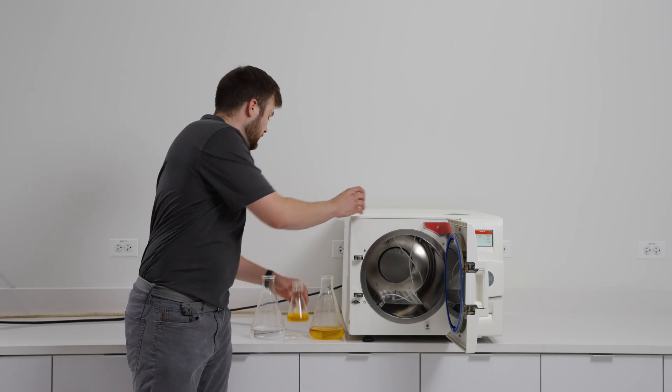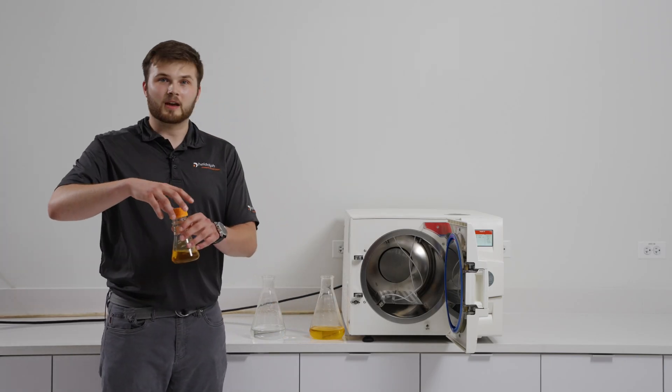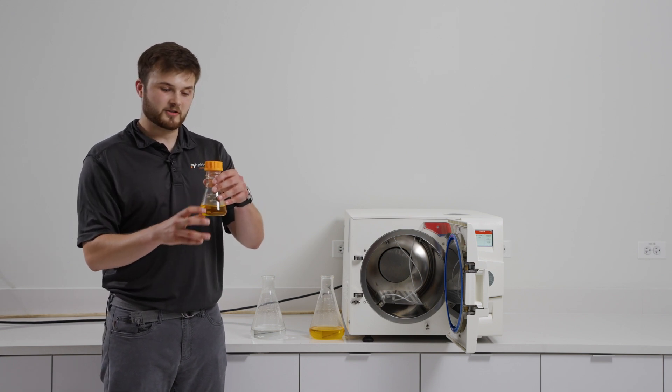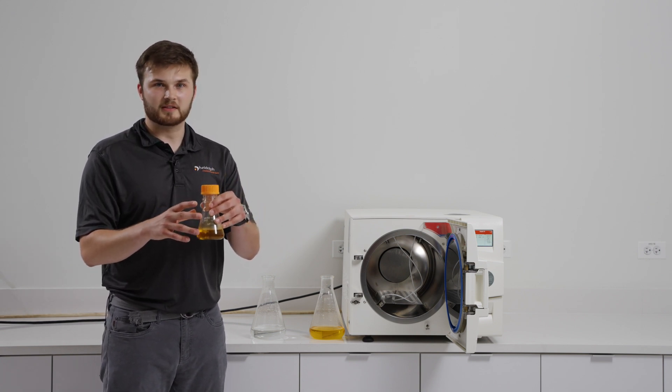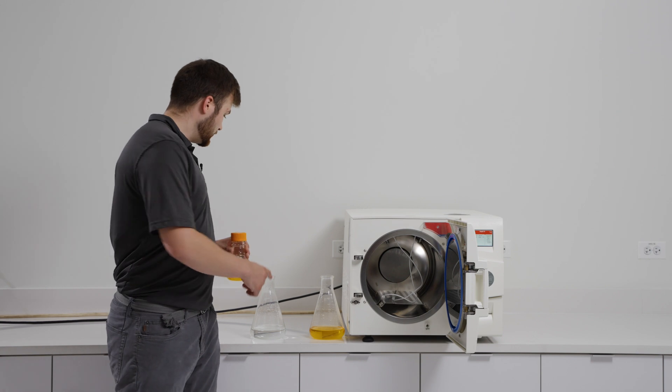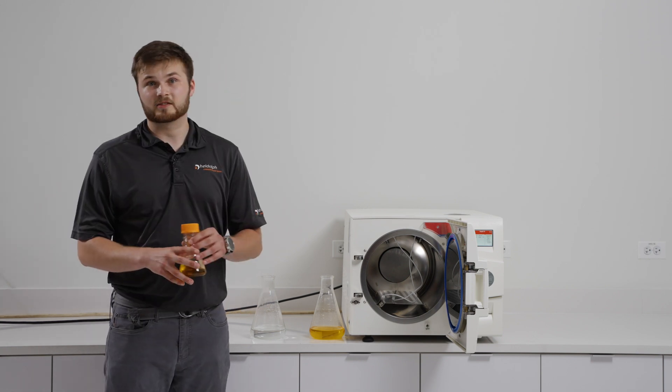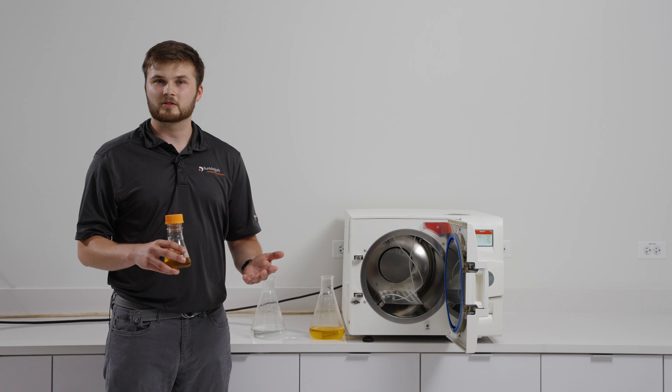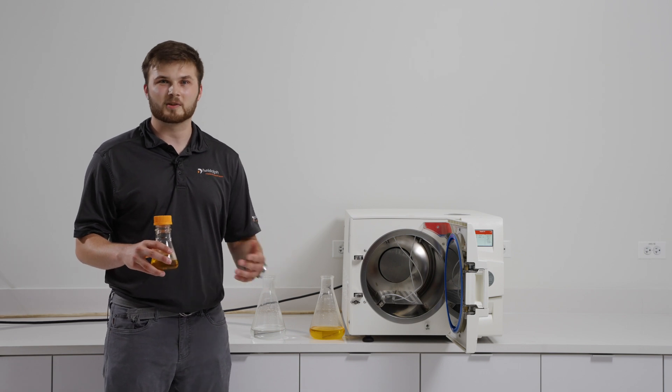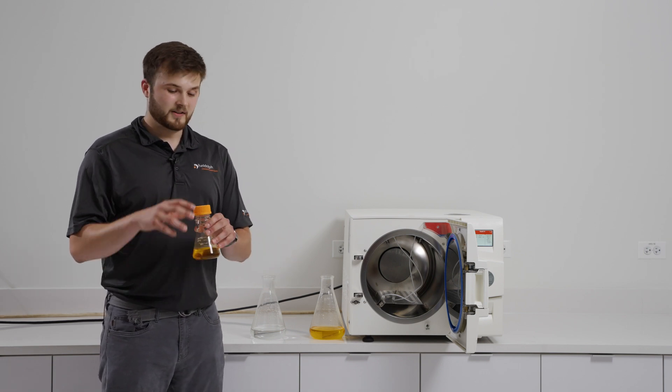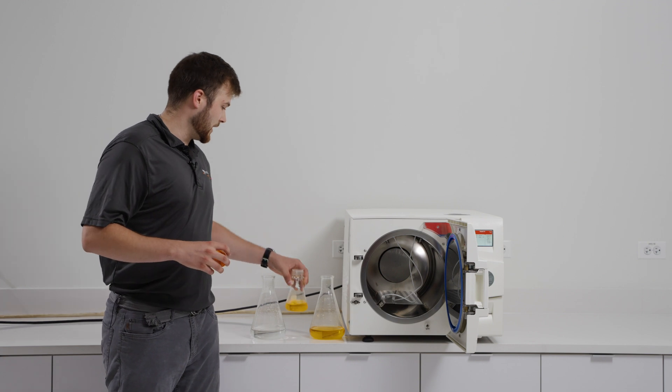When loading your media, if it is necessary to cap each vessel, you can do so, just please make sure to put the cap on very loosely so that pressure does not build up within the vessel causing it to burst. You do not need to cap the control vessel, as this is just where the probes are going to go, but if you would like to do so you can, just again, please make sure it is loose. For this demonstration, I will not be capping my media.